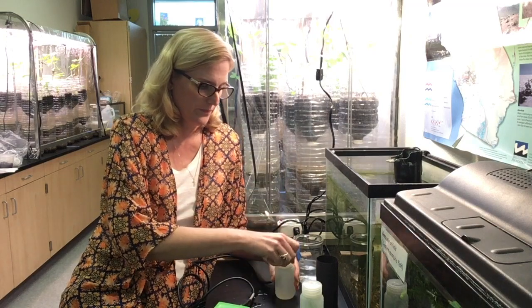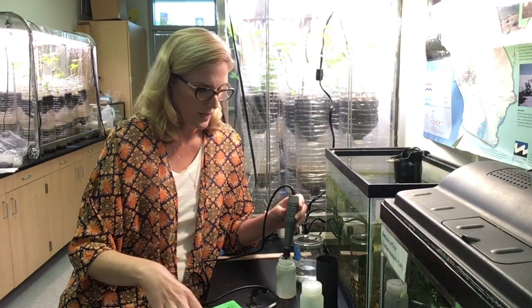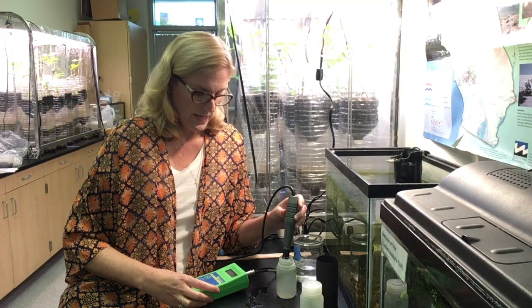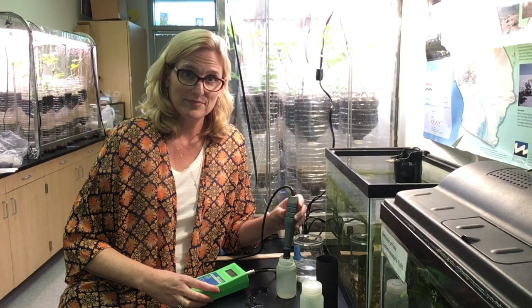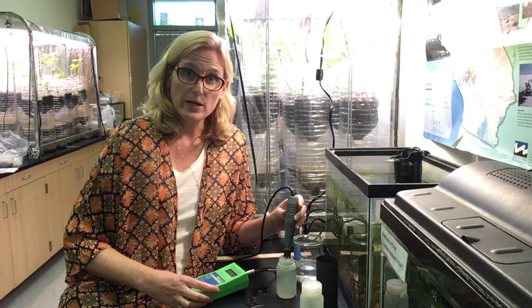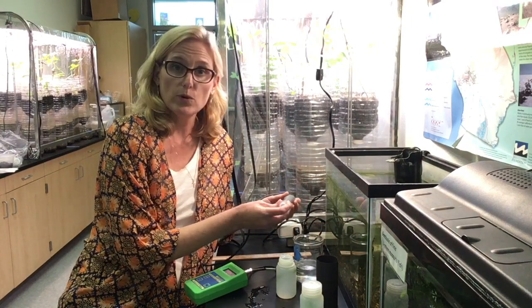Now I'm going to measure the dissolved oxygen of the bottle that was in the dark for 48 hours. Again, it'll take about a minute to get a reading. This one is dropping — we started at 7.4 and it's dropping to 6.6, 6.5, and it continues to fall. After about a minute, the reading is 5.3 milligrams per liter. So to summarize: we started at 7.4, the one in the light read 10.0 after 48 hours, and the one in the dark read 5.3 after 48 hours.